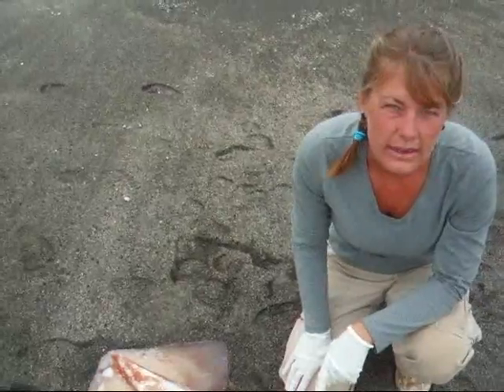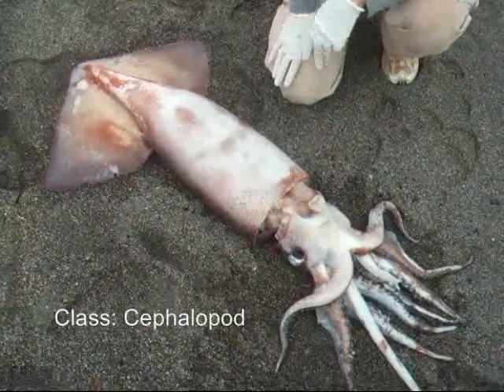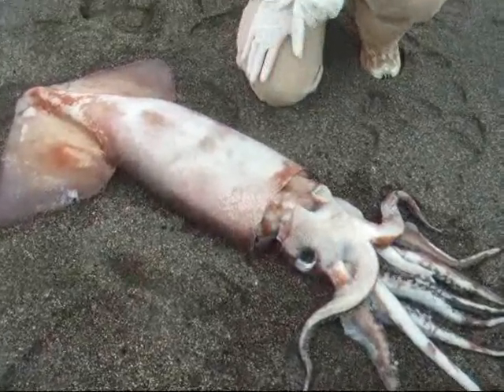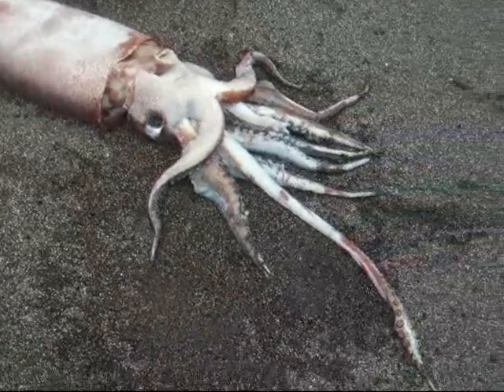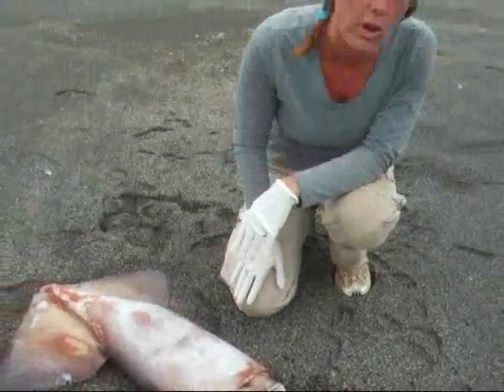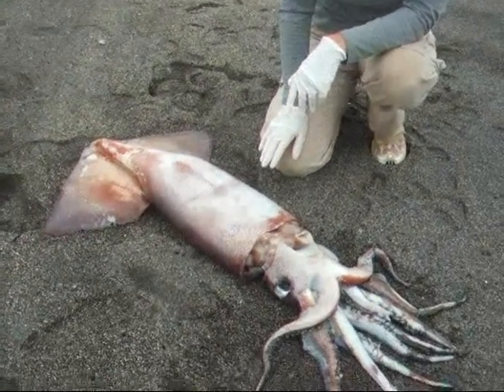This is a squid from the phylum Mollusca, class Cephalopoda. Chances are this is a pelagic squid. It has just washed up here on the beach in the middle part of Chile. So what we're going to do is first start by going over the external anatomy, and then I will cut into the body cavity and we'll go through the internal anatomy.